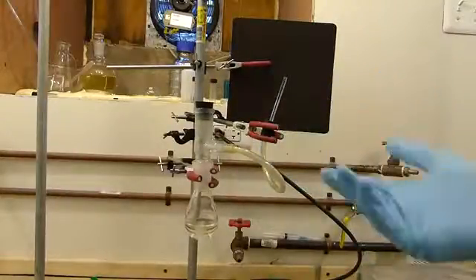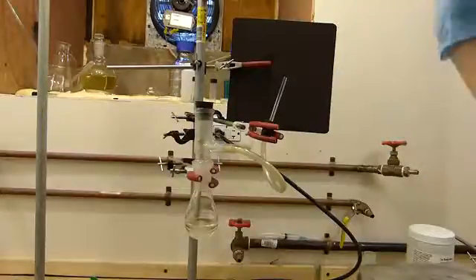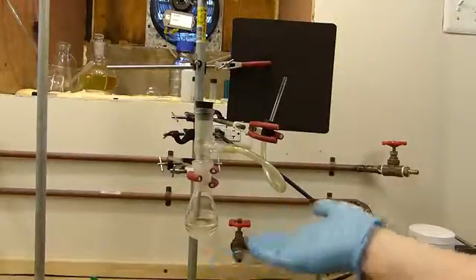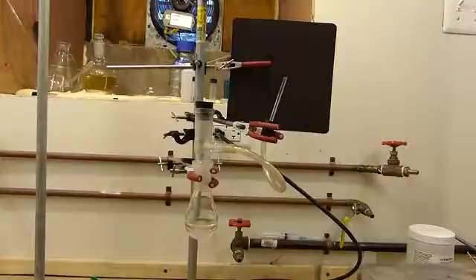I've already tested this apparatus with smoke by generating a large amount of smoke at the tip of this point, and I assured that all the smoke was escaping out of the fume hood. So I do know that any excess carbon monoxide that's being given off and just released into the room is actually leaving the fume hood and not endangering my health at the moment.